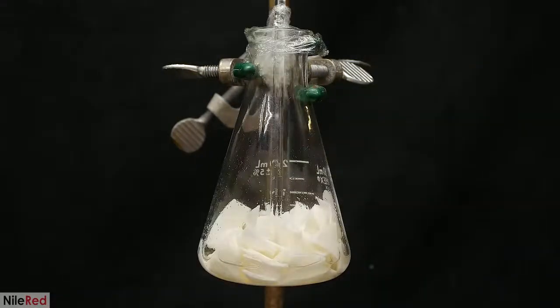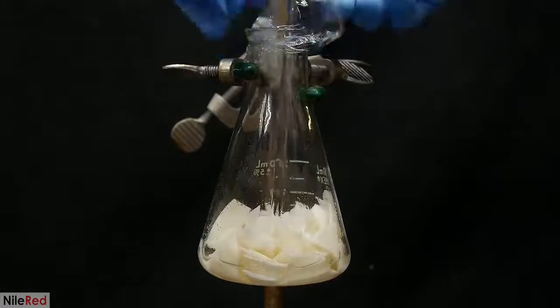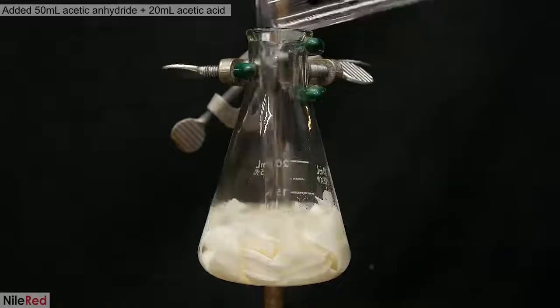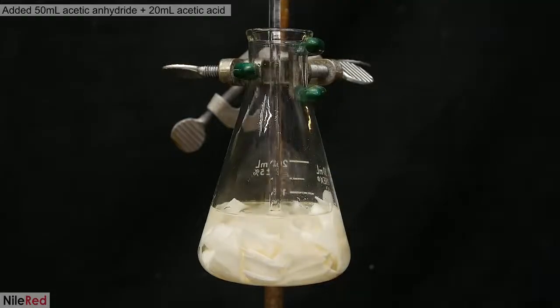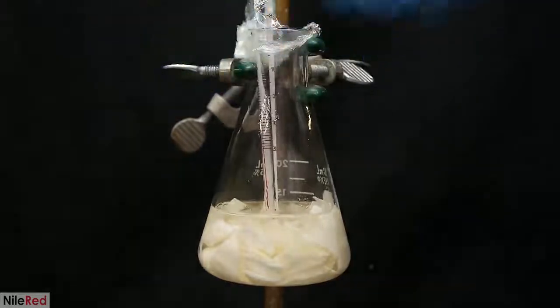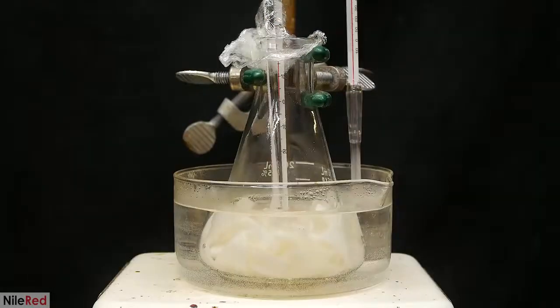So an hour later, the pre-treatment is done, and now it's time to acetylate it. To do this, I add a mixture of acetic acid and acetic anhydride, cover the top, and put it in a hot water bath. I also added a thermometer, but that wasn't really necessary. The water bath's held at a stable 50 C, and the flask is kept here for the next 30 minutes or so.